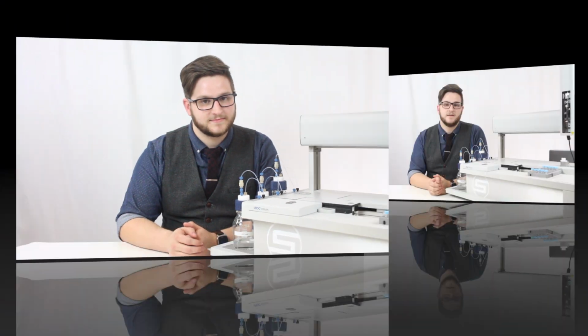If you had any problems, it's most likely due to that one of the fittings wasn't tight. Undo all the fittings, replace the tubing, and retighten, and try again. If that still doesn't fix the problem, feel free to contact us here at RheoSense where we can help you diagnose the problem further.